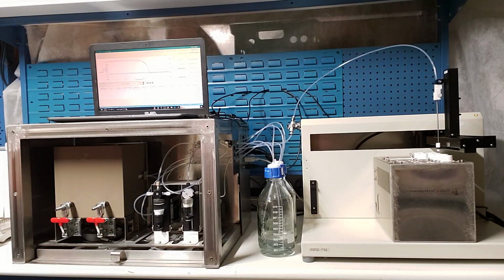So we go from historical systems that run maybe 4, maybe 5 at most samples per hour, to the Model 575 from Haiku Instruments, which is running 12 samples per hour in duplicate. That's 24 injections per hour, all carried out without any user intervention. Again, we're running in water, and all of our waste is going to this other container. Sample preparation volumes are around 20 milliliters, and the analysis requires a further 2 or 3 milliliters of solvent for flushing and cleaning the system.